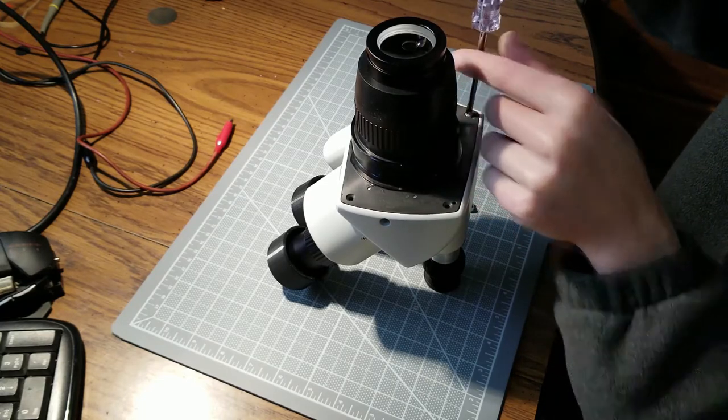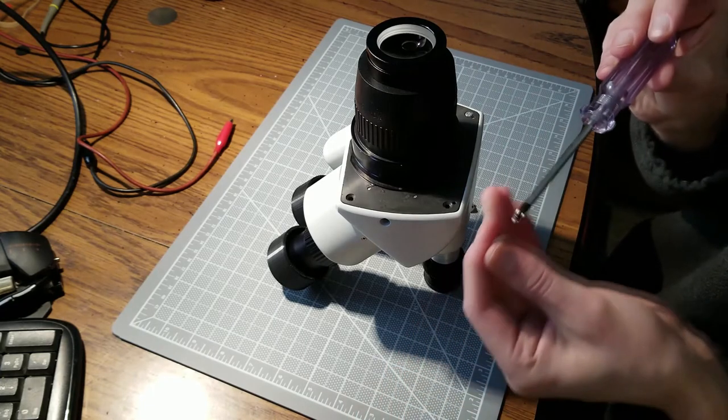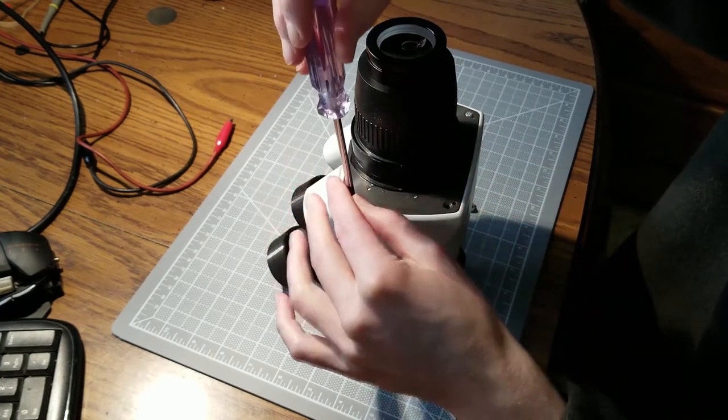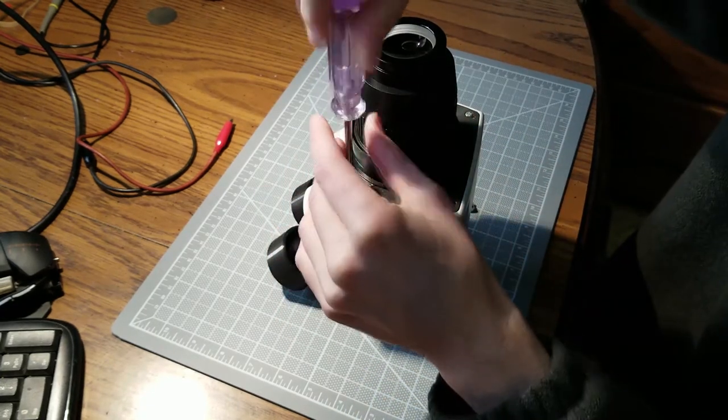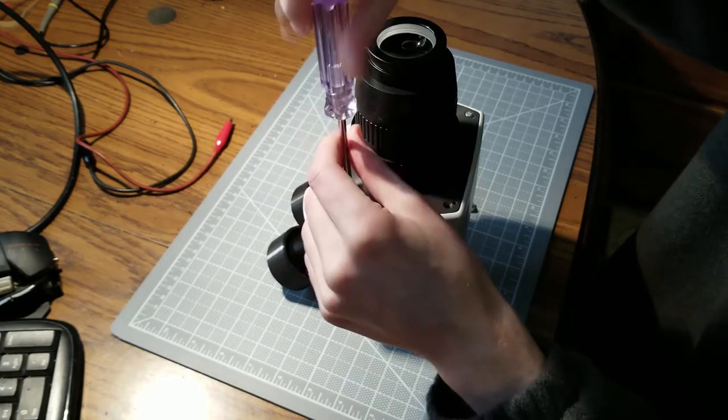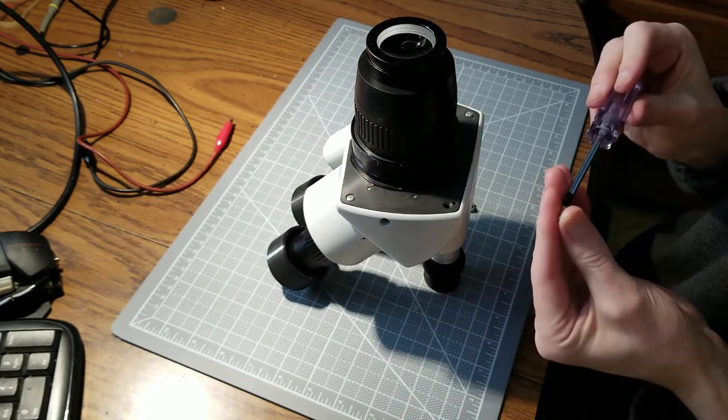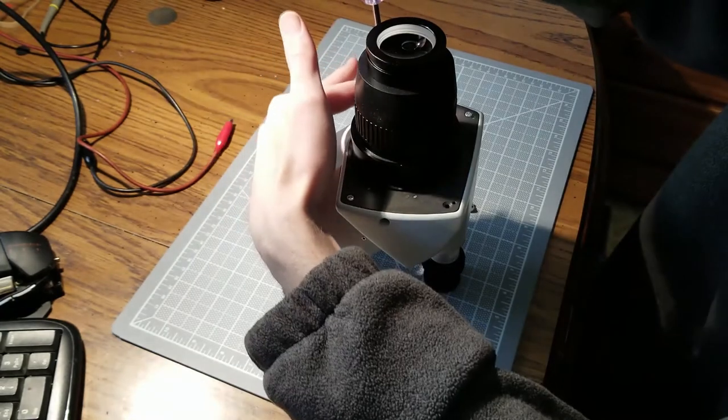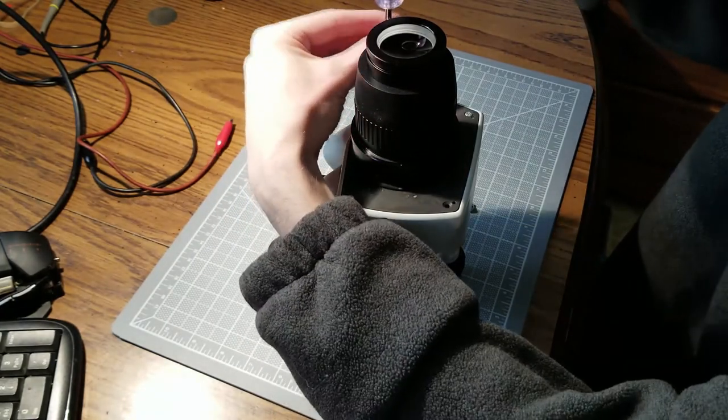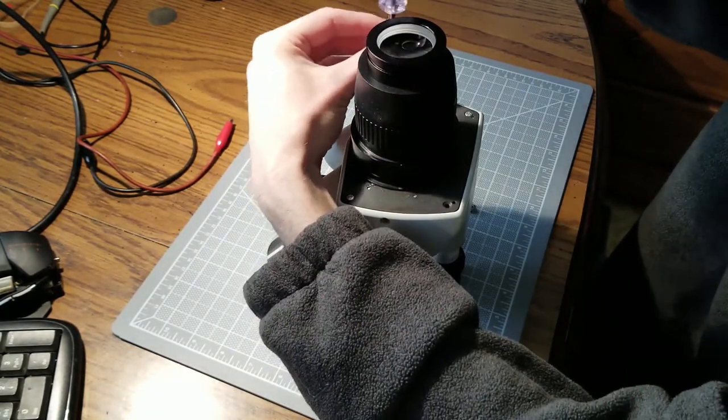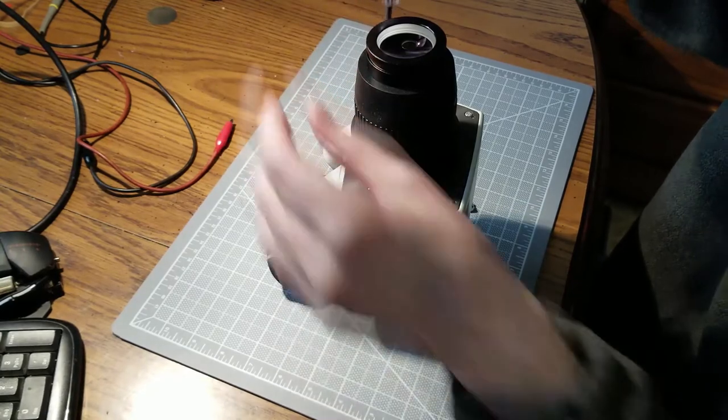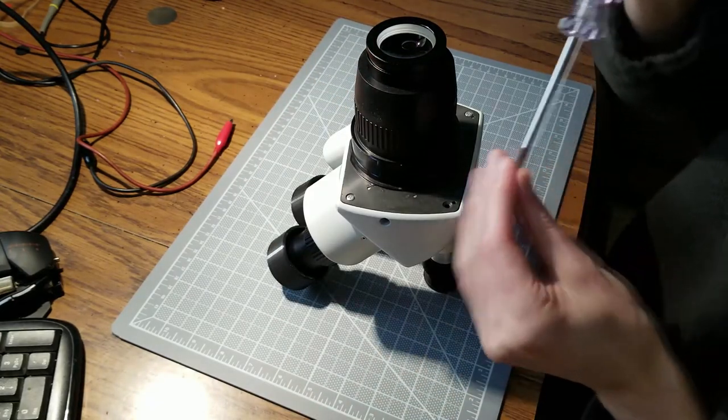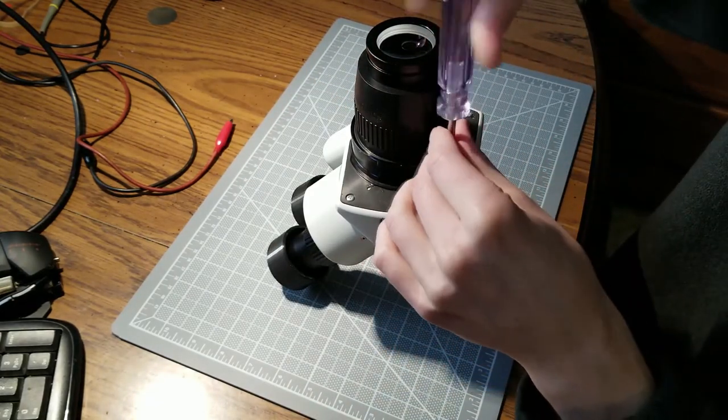So that's basically it. Right now I think I have a 2x lens on here. Put it back together and unfortunately there's no way to remove any sort of shutter on this model right here.